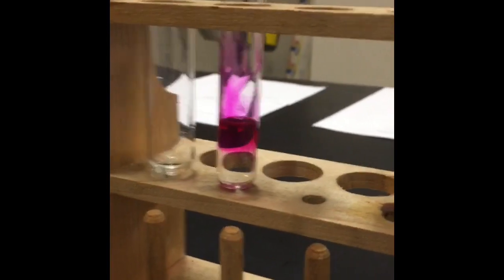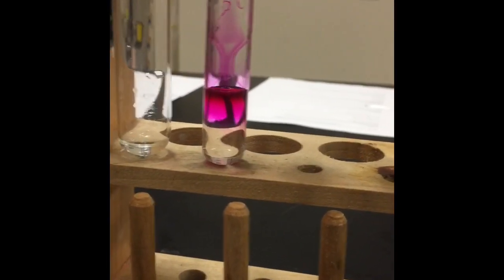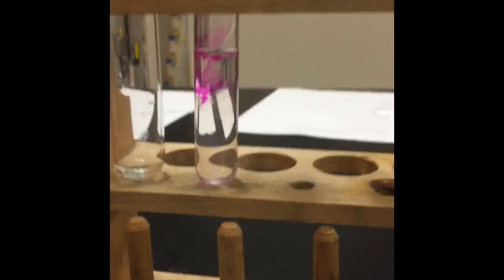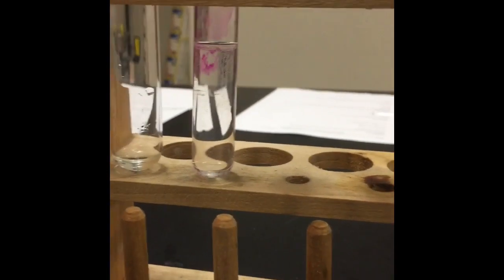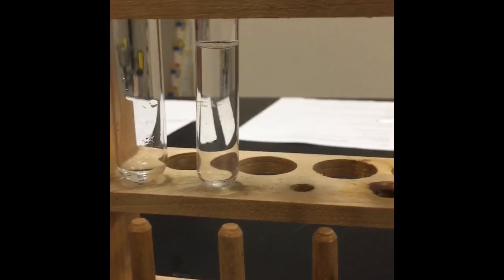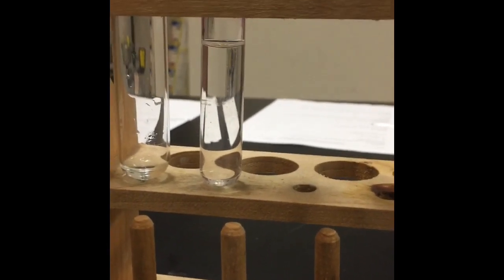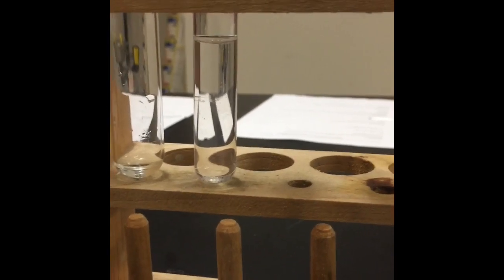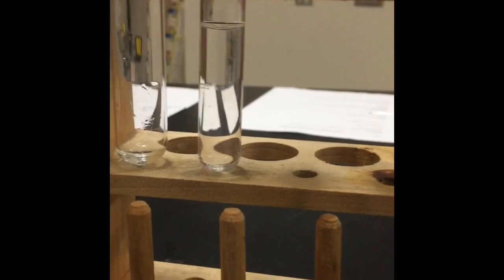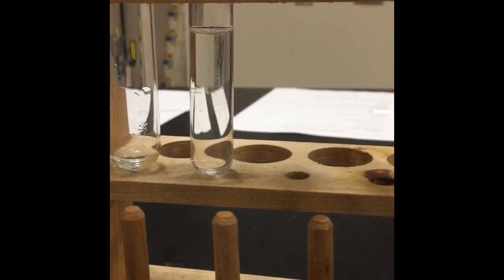Okay. Now to that base, sodium hydroxide, I am going to add hydrochloric acid. Notice that the pH indicator is no longer indicating that a base is present. Instead, it's clear, like water. So I put together sodium hydroxide and hydrochloric acid, and it seems to have turned into water as one of the products. There is going to be a second product here, but water is one of the products. So think about what type of reaction that would be if I put together hydrochloric acid and sodium hydroxide and ended up with water and another product. Okay?